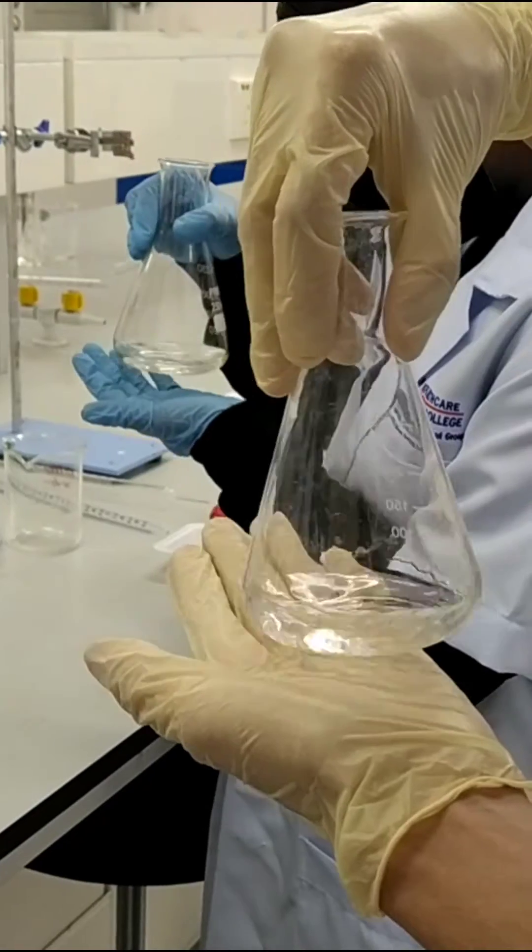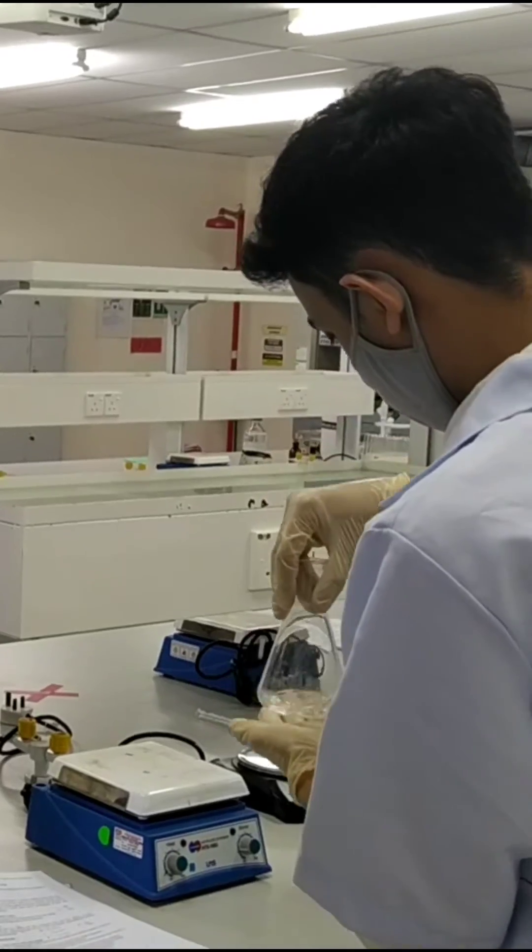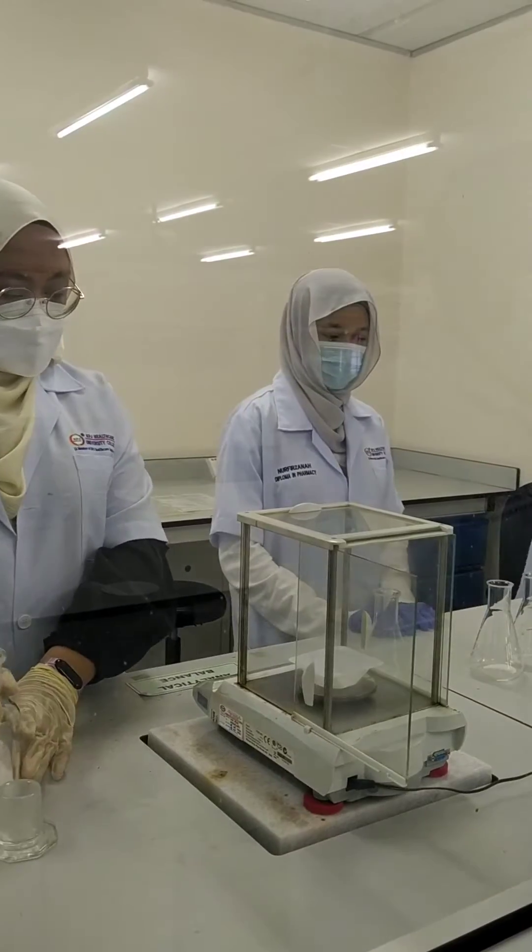Dissolve the samples with distilled water, 20 ml. Make sure all are dissolved.